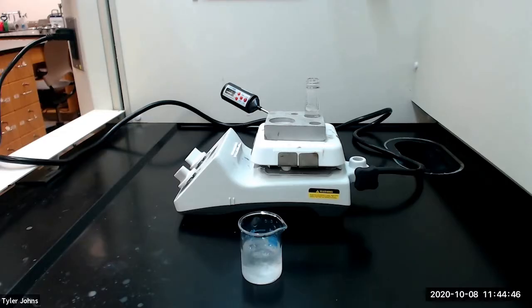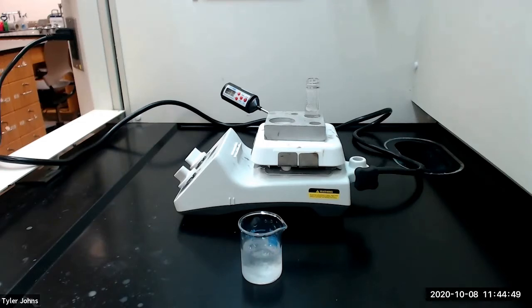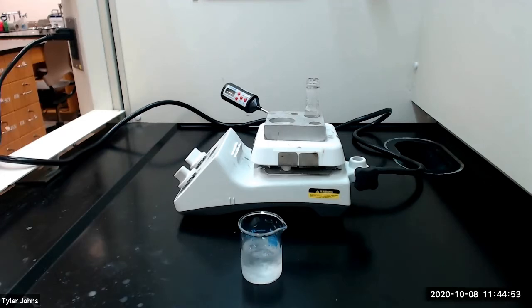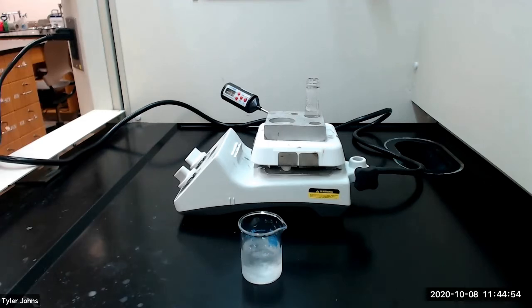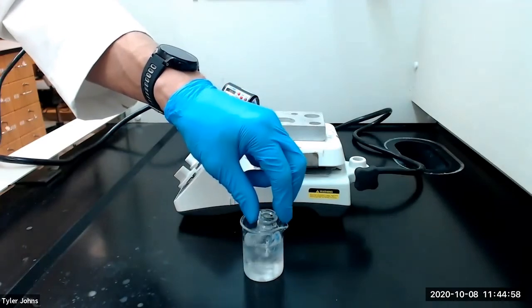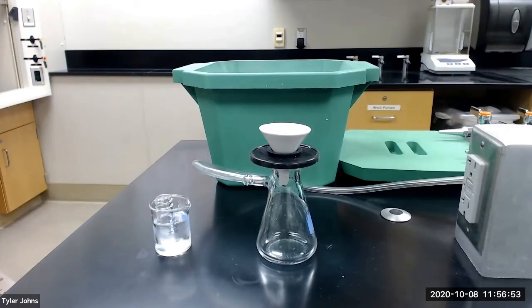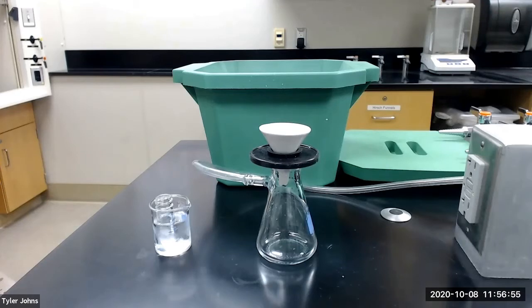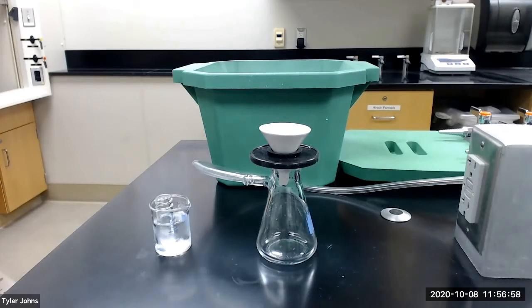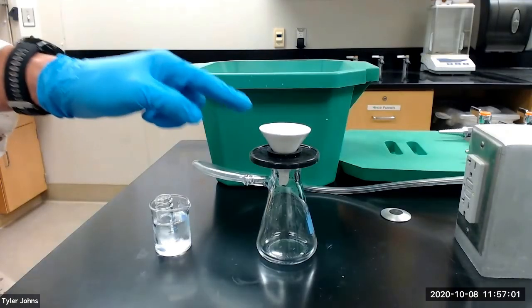After heating for 15 minutes, we need to re-precipitate the decolorized acetaminophen by placing the 5 milliliter conical vial in an ice water bath. After our acetaminophen has re-precipitated, we will collect our purified acetaminophen crystals by vacuum filtration on a Hirsch funnel.